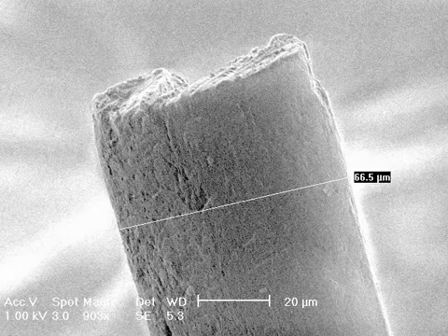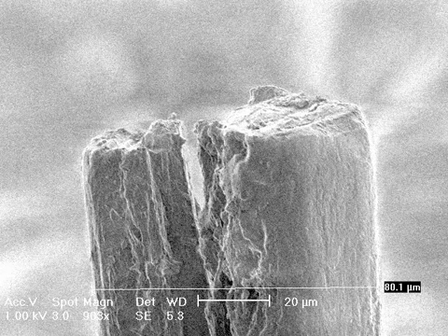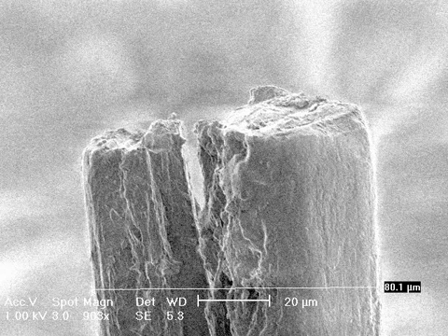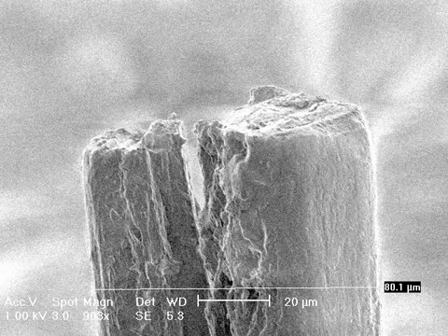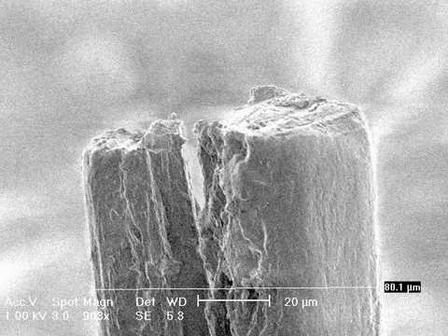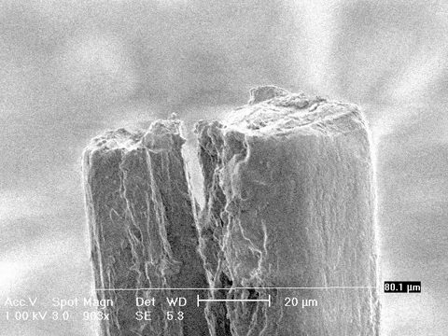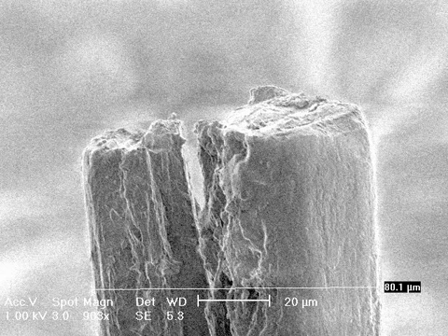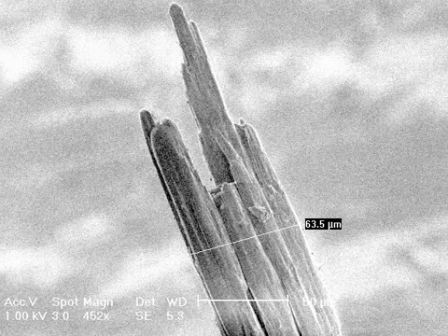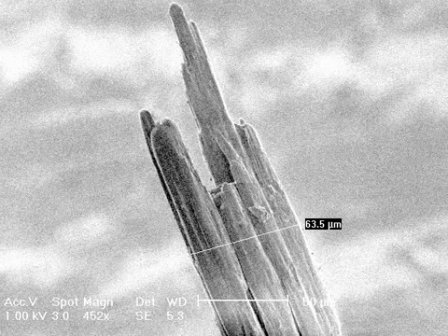If we go along the other flag we find the diameter of 80 micrometers, and we see that this flag is again splitting into two parts. That is one of the reasons the diameter is larger than for the other flag. We can also find tips like this, where the diameter is 63.5 micrometers.